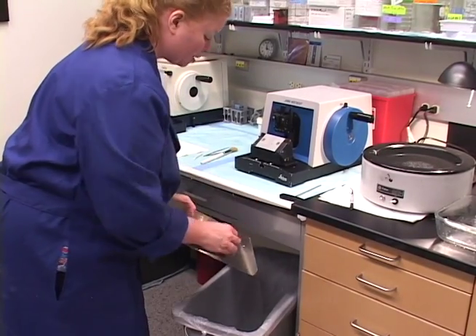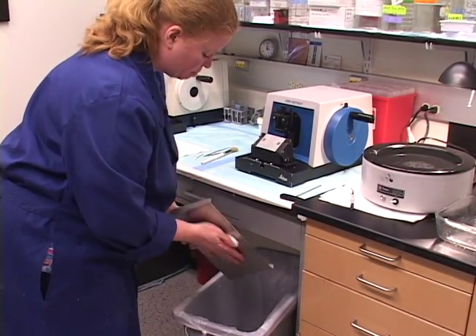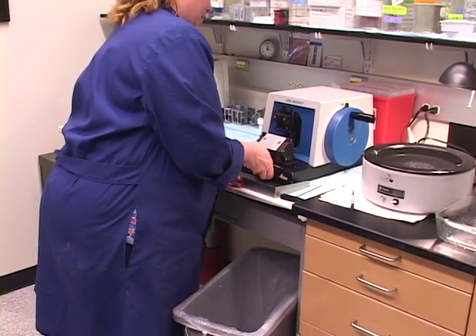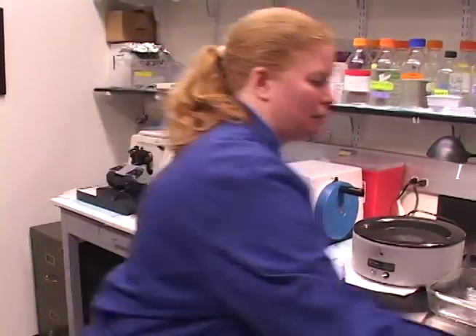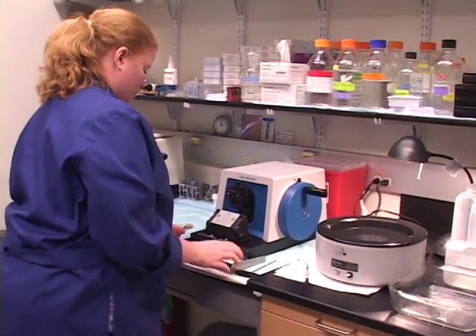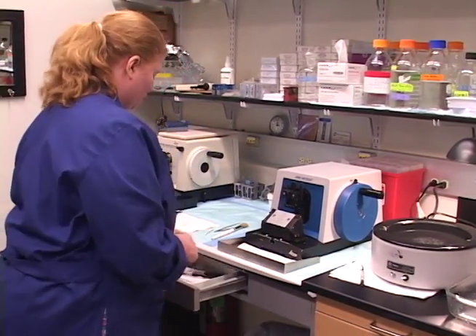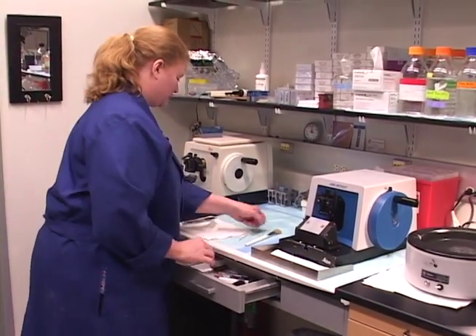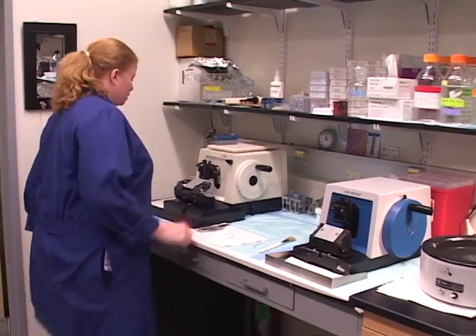You can't do that with the plastic one because it'll eat it and melt it, but you can with this metal one. And that's it for that — that one's nicely cleaned. Put a paper towel in there to catch some residual paraffin. We'll put these all back in the drawer so everybody knows where they're at.